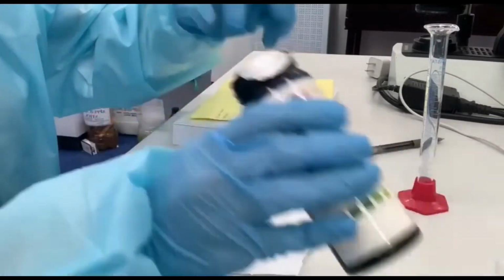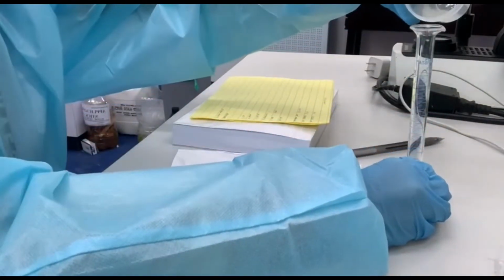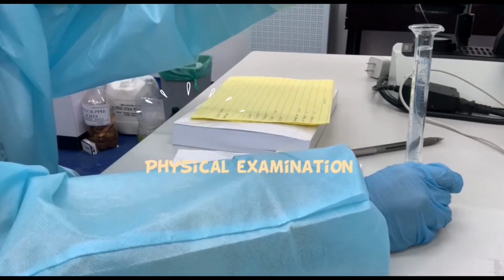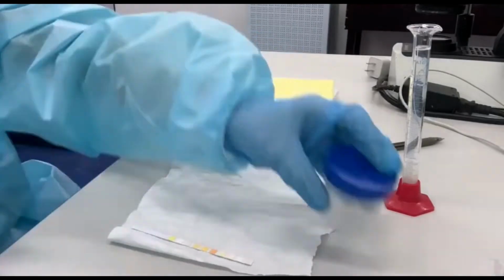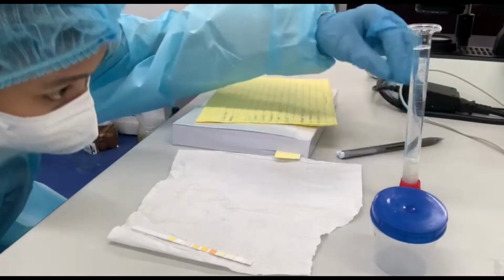Then, record the time collected, time liquefied, and liquefaction time. Then, check for the physical appearance of the semen, such as its color, its appearance, viscosity, volume, and the pH of the semen.